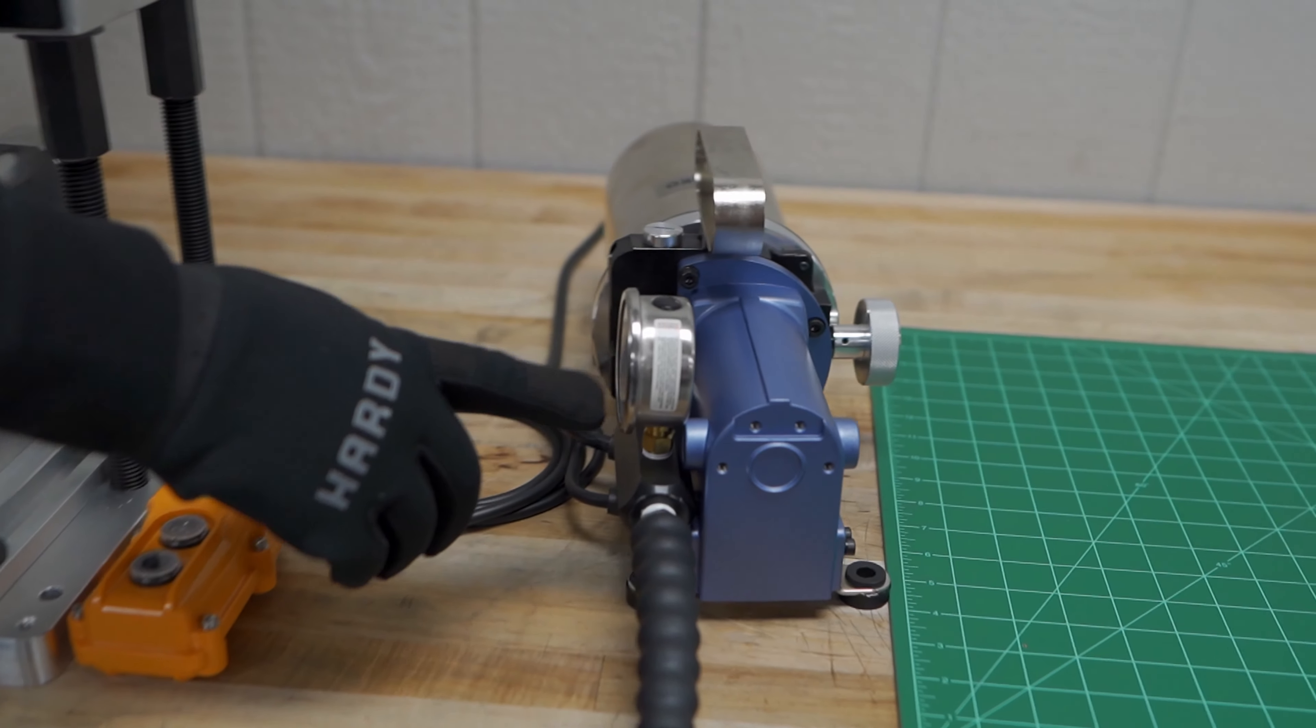Wait a few more seconds for the part to cool in the mold, and then we will release the hydraulic valve on the power unit. The clamp will retract, and now we can pull our mold from the machine.